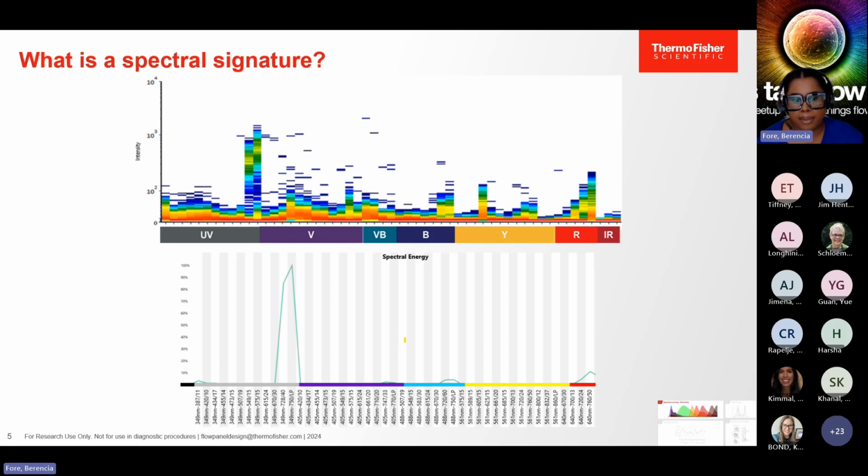Now when we look at the bottom, this is still BUV 737. However, the signature has been normalized. Before unmixing happens, normalization occurs, and it's defined as the process of subtracting the autofluorescence from cells or beads that have been stained, which ensures that only the fluorophore signature is used as a reference to deconvolute the fluorophores in the sample. A panel design tool will show a clean normalized signature, which means the tool has already accounted for autofluorescence.